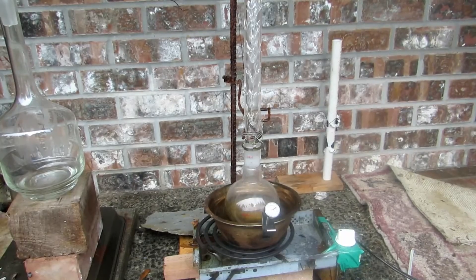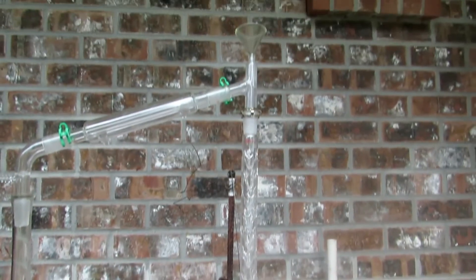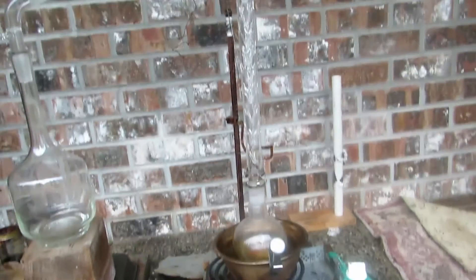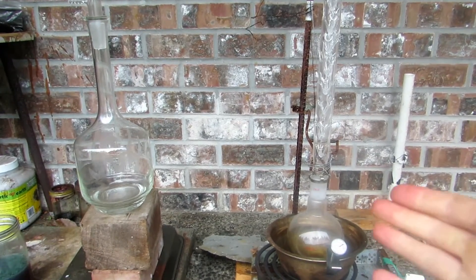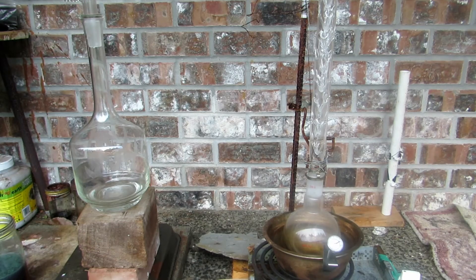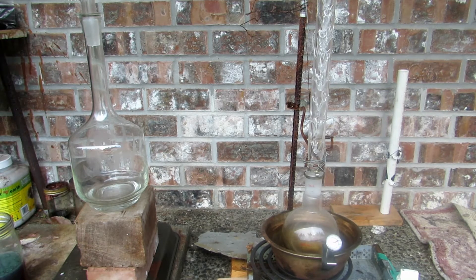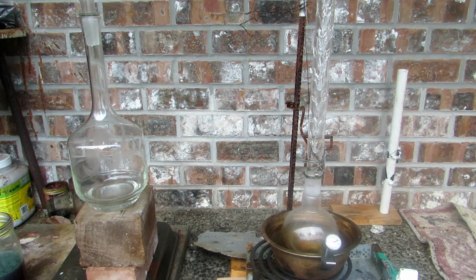The whole apparatus is now set up outside. The only difference is that at the very top we have a funnel instead of a thermometer — this is where I'm going to be adding the paint stripper, which is a gel, so hopefully the addition works. If not, you can always take off the Keck clamp and add it straight to the round-bottom flask. The oil is getting warm — just monitor your thermometer, and when it hits about 40°C that means we're mostly distilling dichloromethane.